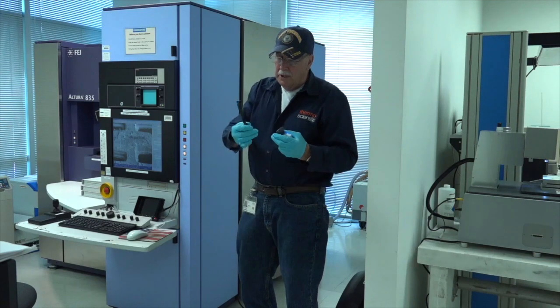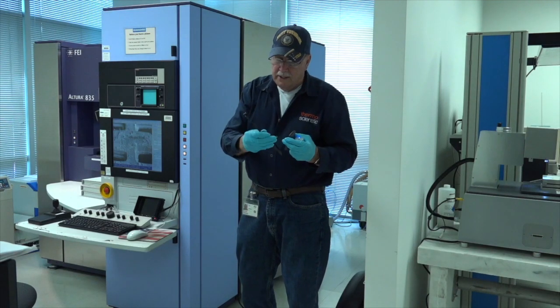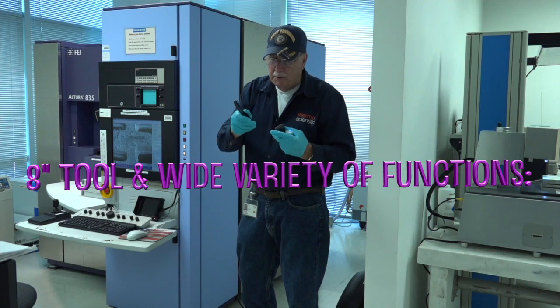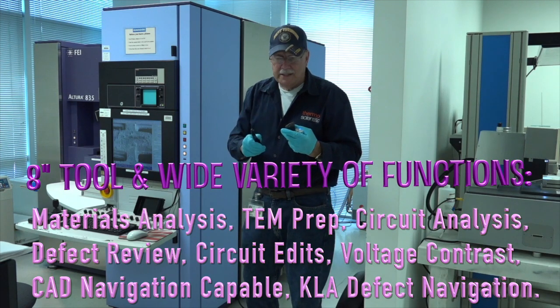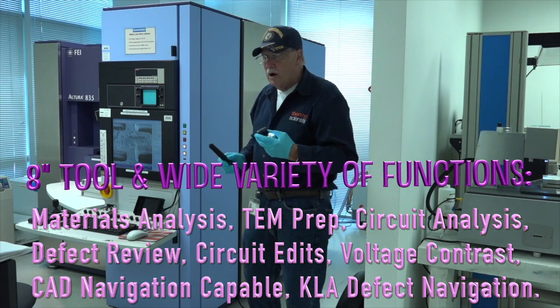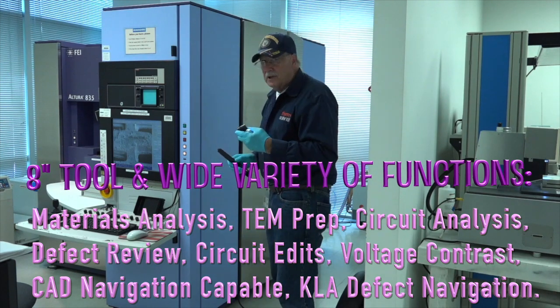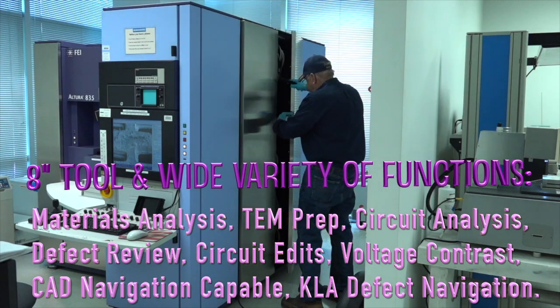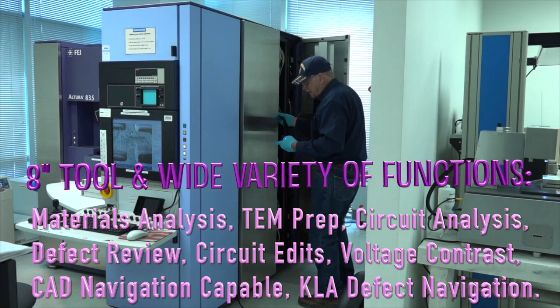We open them up with a little tool that looks like this — it's got a little finger on it. We slide it between the doors and pull down the tab that's on the inside. It doesn't show the hardware on the outside, which makes for a nice clean package. The tab is right here — pull that down and you can open it up just like that.